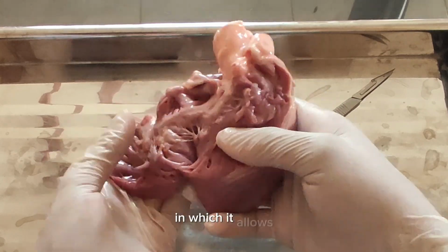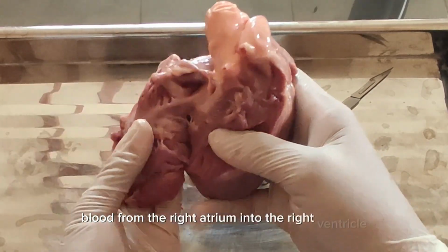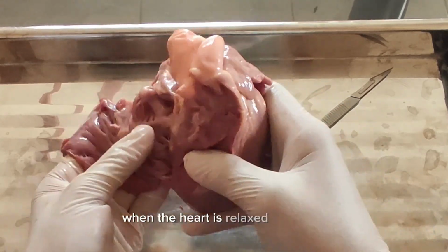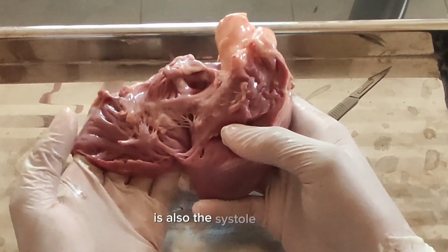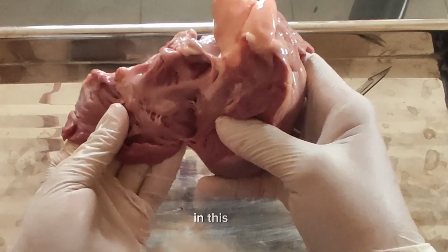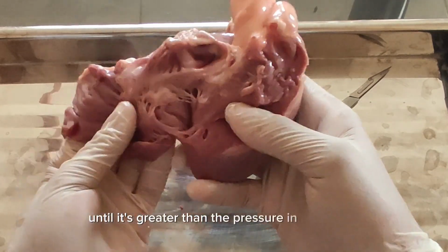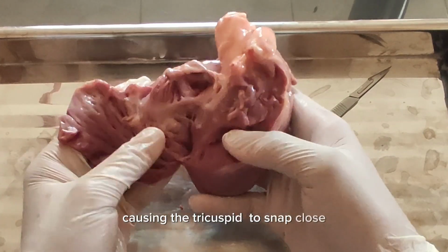in which it allows blood from the right atrium into the right ventricle during diastole. It's a period when the heart is relaxed, everyone. When the heart begins to contract is the systole phase. In this part, the ventricular pressure increases until it is greater than the pressure in the atrium, causing the tricuspid valve to snap closed.